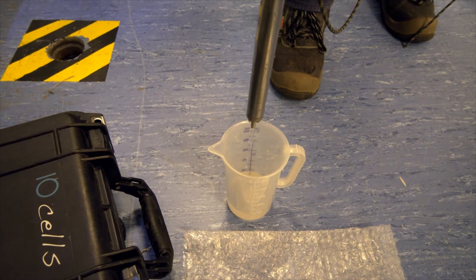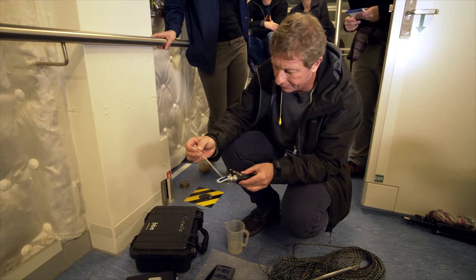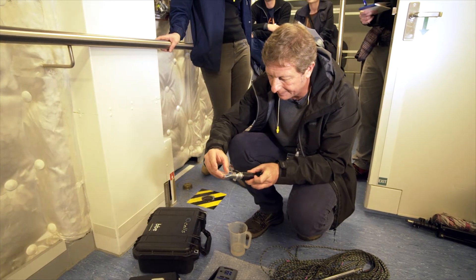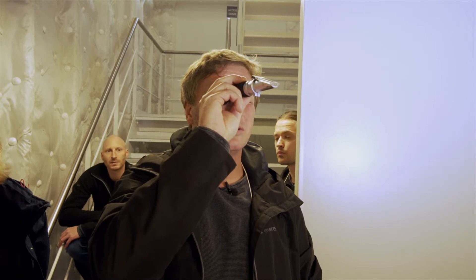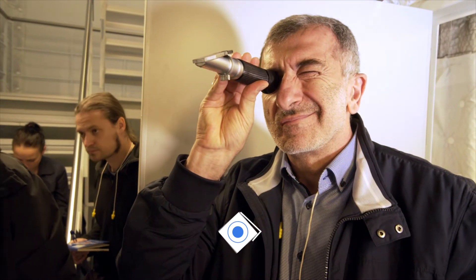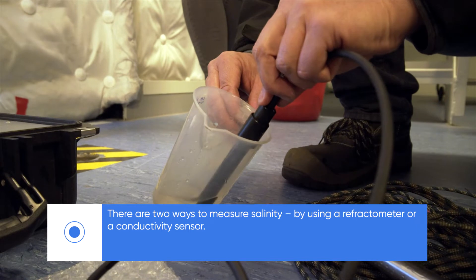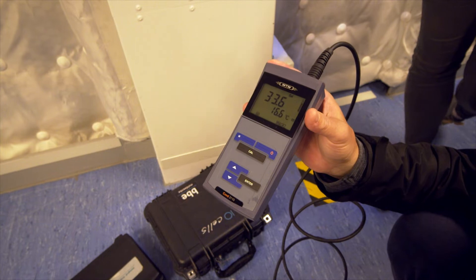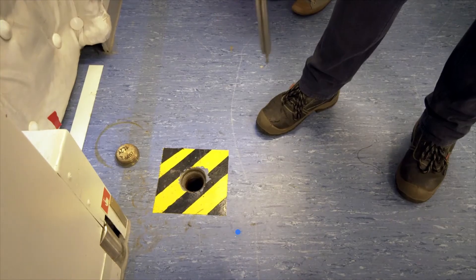To check salinity, there is a little water needed for this. Then you just check it — the light is just perfect to help us. That's showing quite high salinity. It shows salinity in PSU, practical salinity units, and it's correct for what is expected in that area.